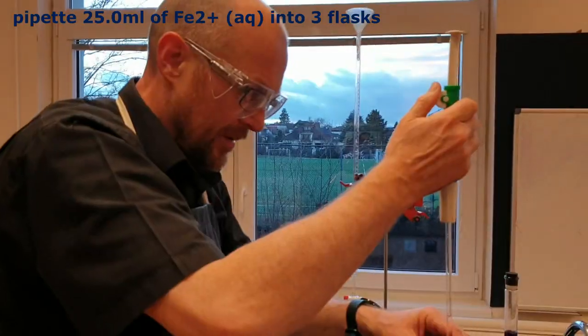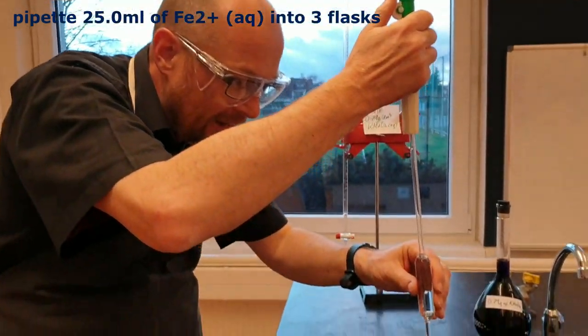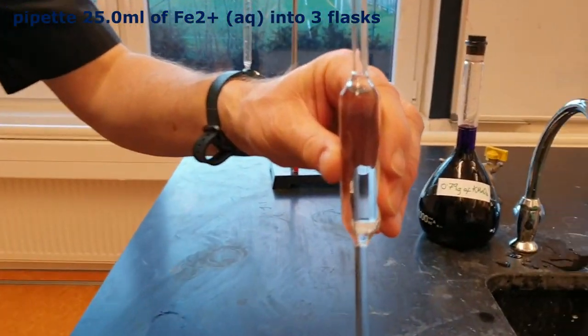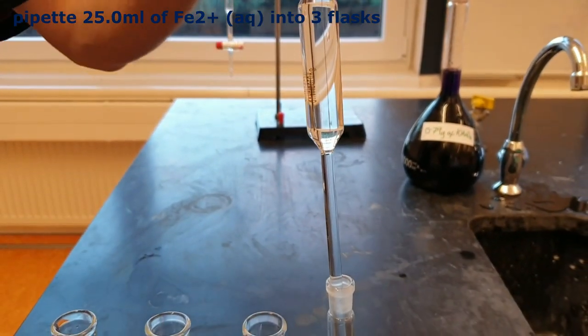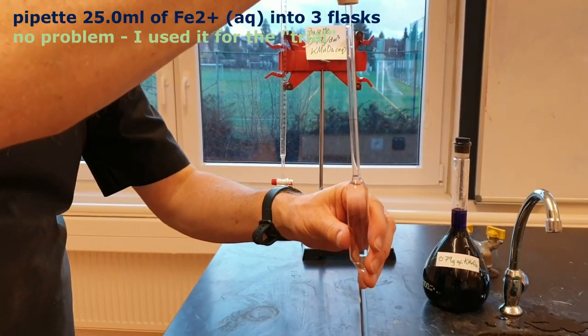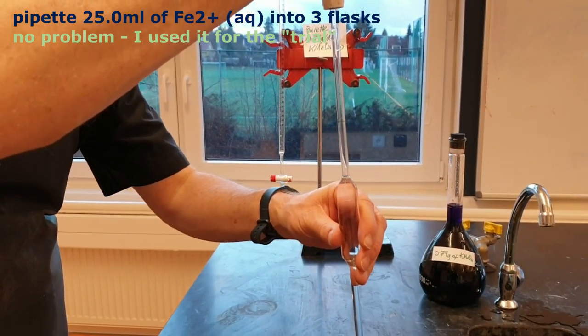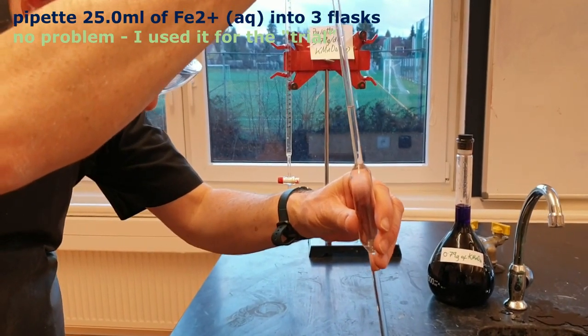Oh no. So my glasses stopped me seeing clearly and I sucked a little bit of the solution up into the pipette filler, which is never good. Didn't go too far though. So that means there's a tiny drop of whatever residue in the pipette filler now into my quantitative chemistry. Okay, I'm filling up to the line.